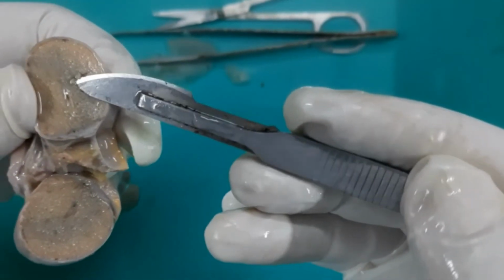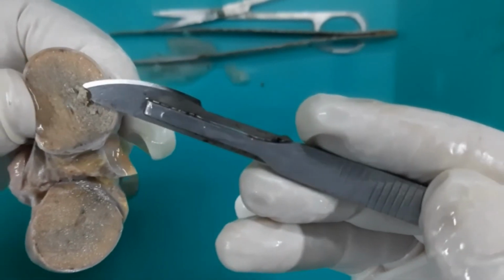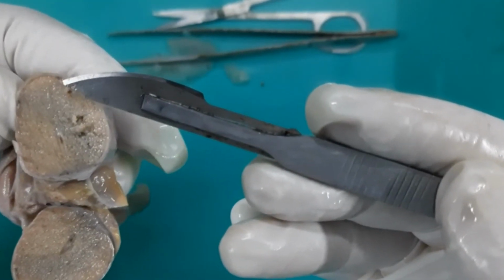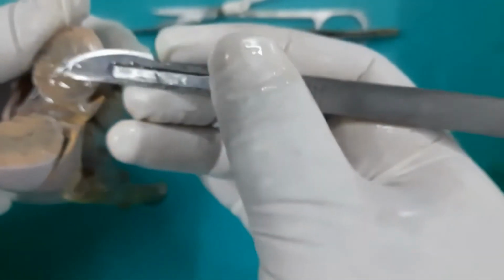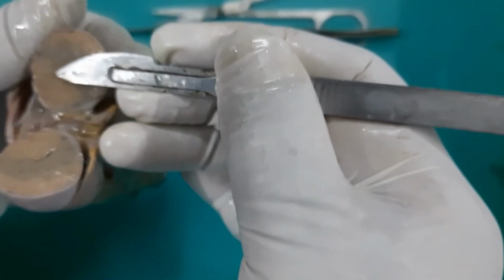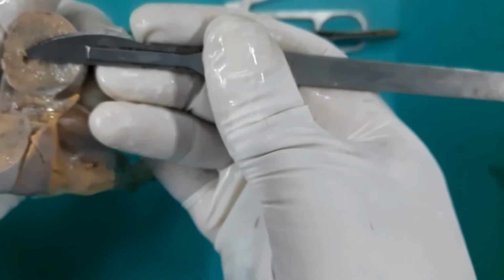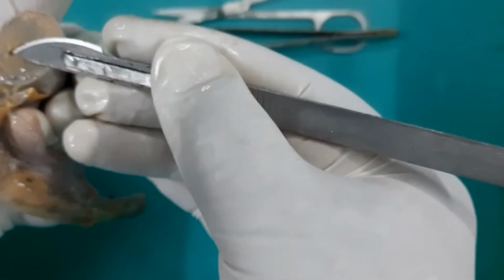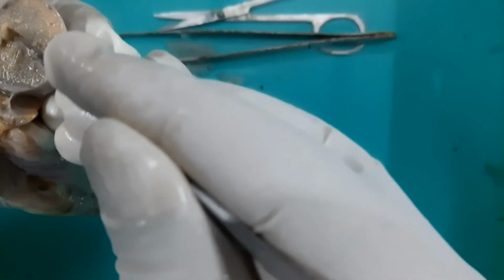Okay, I will try to lift this seminiferous tubule. These are the coiled tubes. These are all seminiferous tubules, if you can see it. These are the fine coiled tubules. This has to be an underwater dissection just to lift some of the tubules. I will try to lift. Yes, I could see it. Okay, these are the coiled seminiferous tubules. They are compactly packed here.